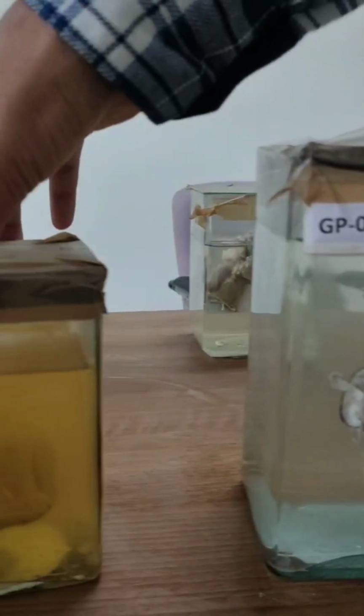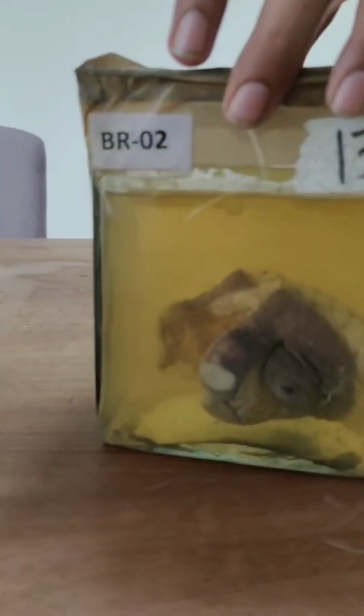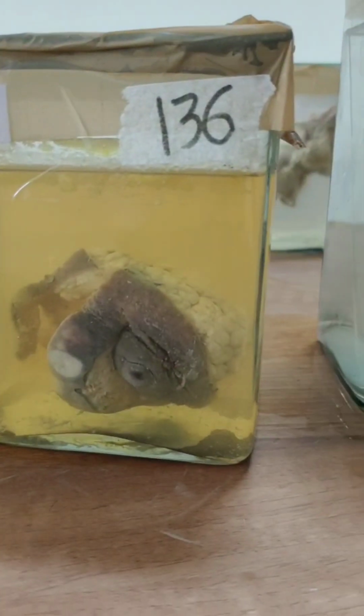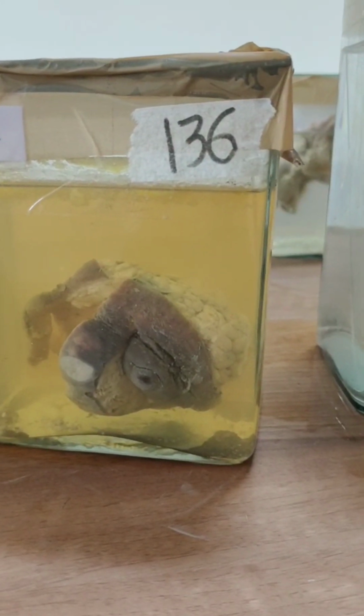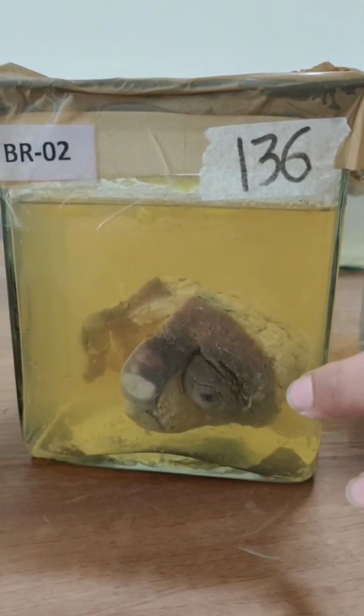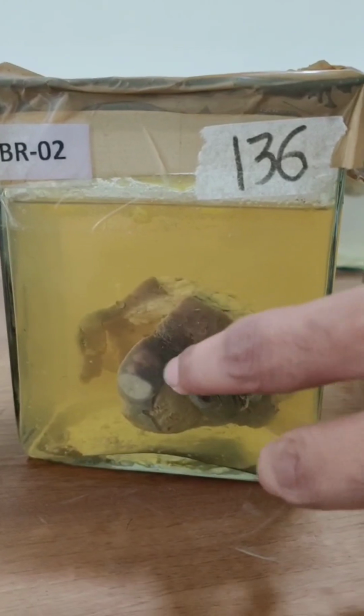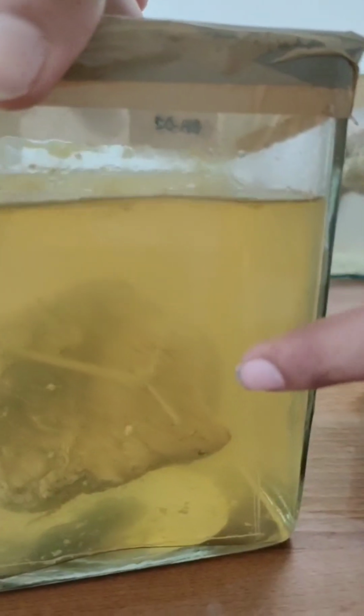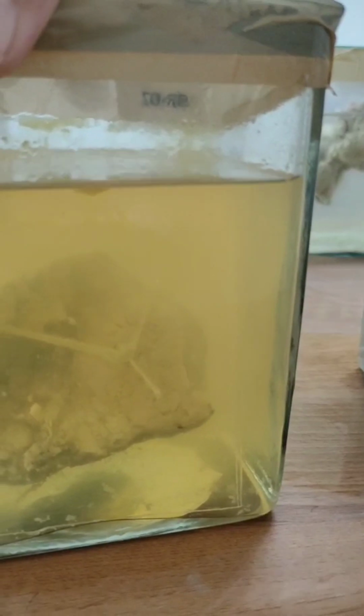Okay, so moving on to the next gross specimen. Here you can see this is the skin, this is the nipple, and this is the areola. Most probably it will be breast carcinoma only. Everywhere it is common, but you should tell the normal anatomy, like whatever you can see, this is the fat, skin, everything. Pathology is here behind. Backside some pathology is there. So most probably this is a breast carcinoma.